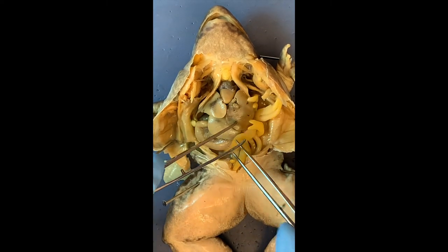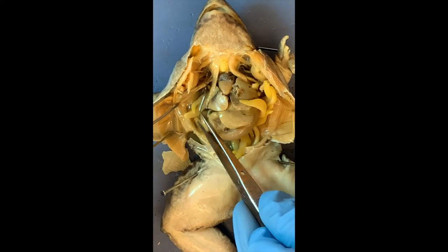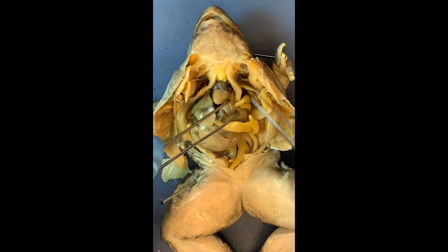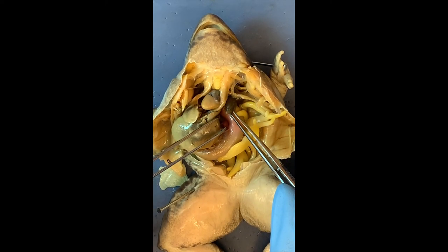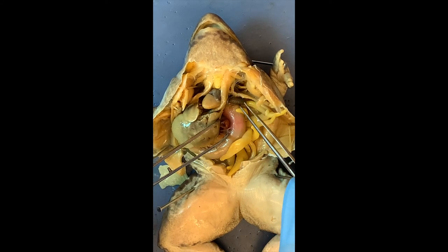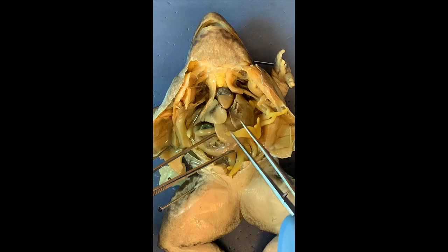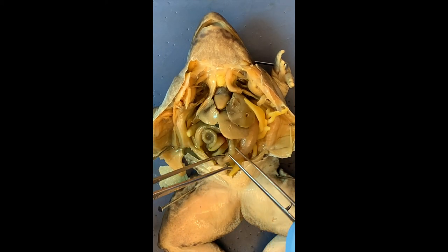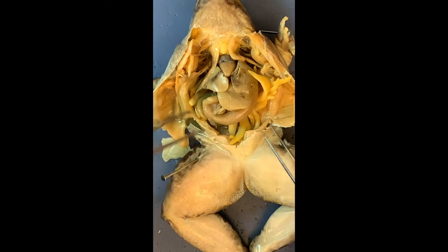Can you point out the fat bodies again? They look like fingers all over — energy storage. So to recap: fat bodies; the heart with only three chambers — two atria, one ventricle; the lungs, one on each side, primitive and spongy; the liver with three lobes; the gallbladder; the stomach; the small intestine leading to the large intestine, which leads to the anus. Excellent job, Professor Voza.